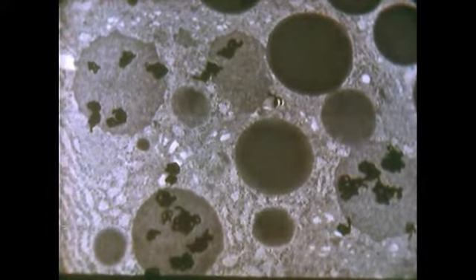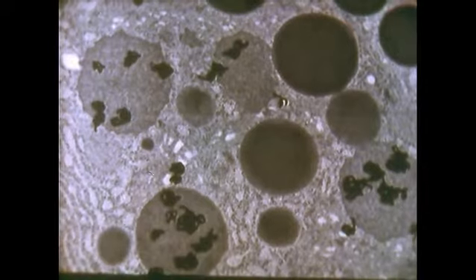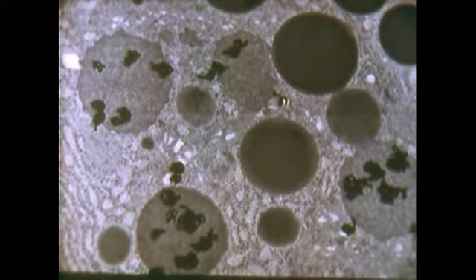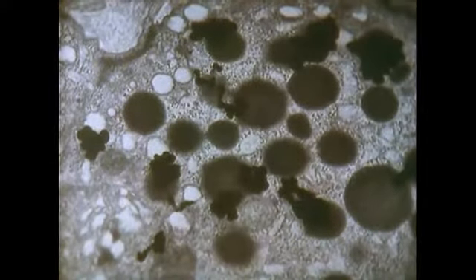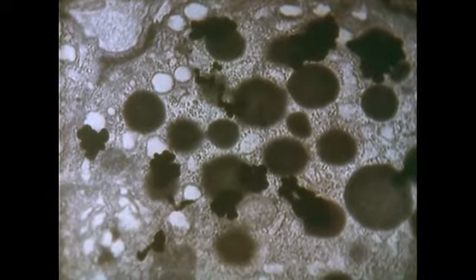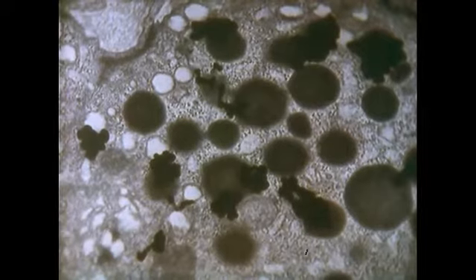After 40 minutes of chase, they are on the other side of the Golgi complex over condensing vacuoles. And after an hour or 2 hours, they are over mature secretory granules, which are called, in this case, zymogen granules. To quantitate the results, we count the grains over each compartment as a function of time from the end of the pulse during the chase.